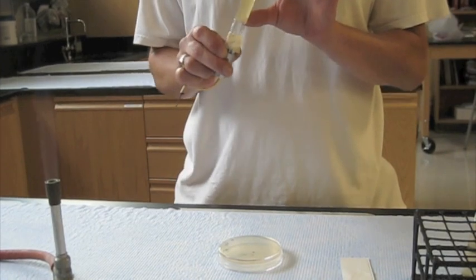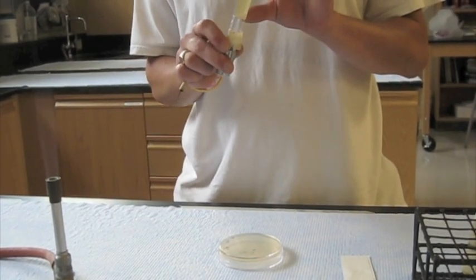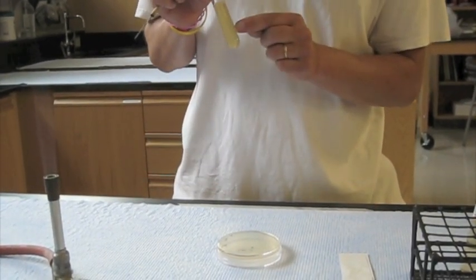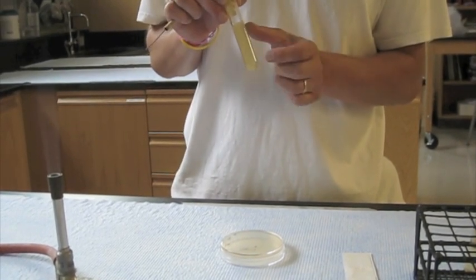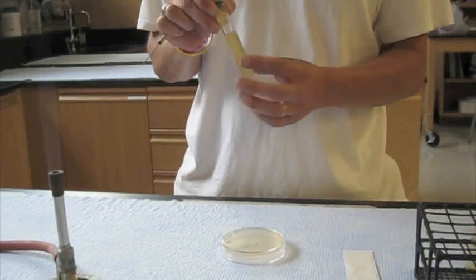And as you can see by tipping this, it is not a liquid media, but a solid media. This will allow us to get bacteria down below the surface, where if they were anaerobic or if they can digest the media, if it's nutrient gel, you'll be able to see that.